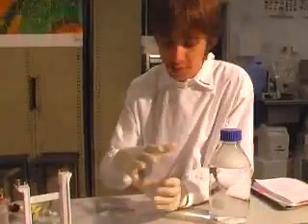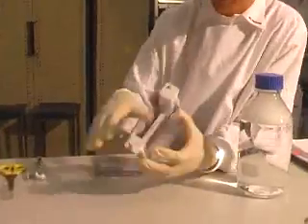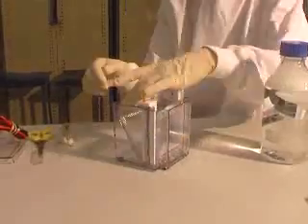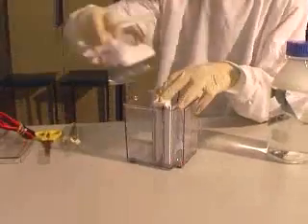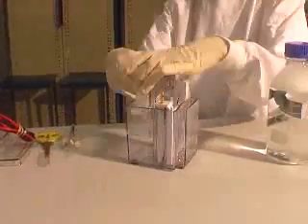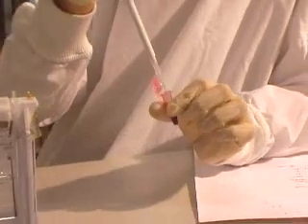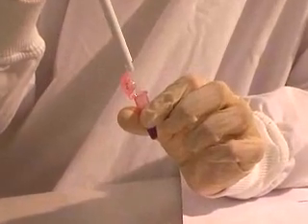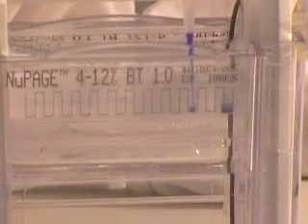Electrophoresis is used for determining the size of molecules, and different types of gels are used for different substances. The gel consists of a matrix of fibres. Smaller particles travel through the gel more easily, therefore they are found towards the lower end, while larger particles are observed at the top of the gel.